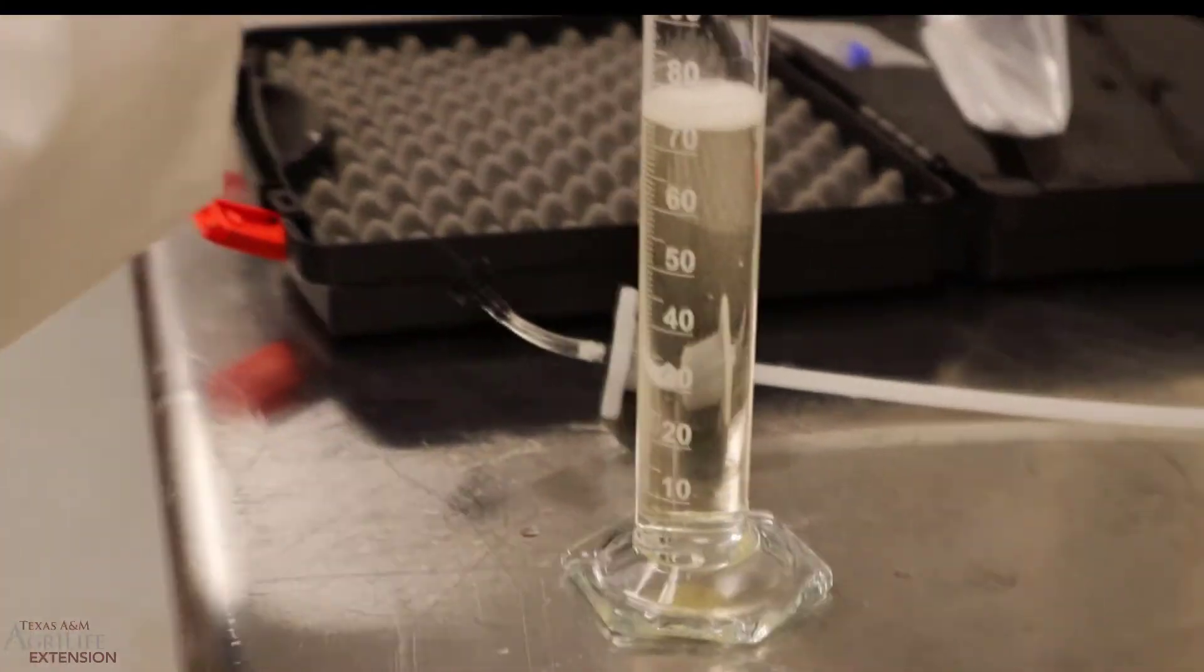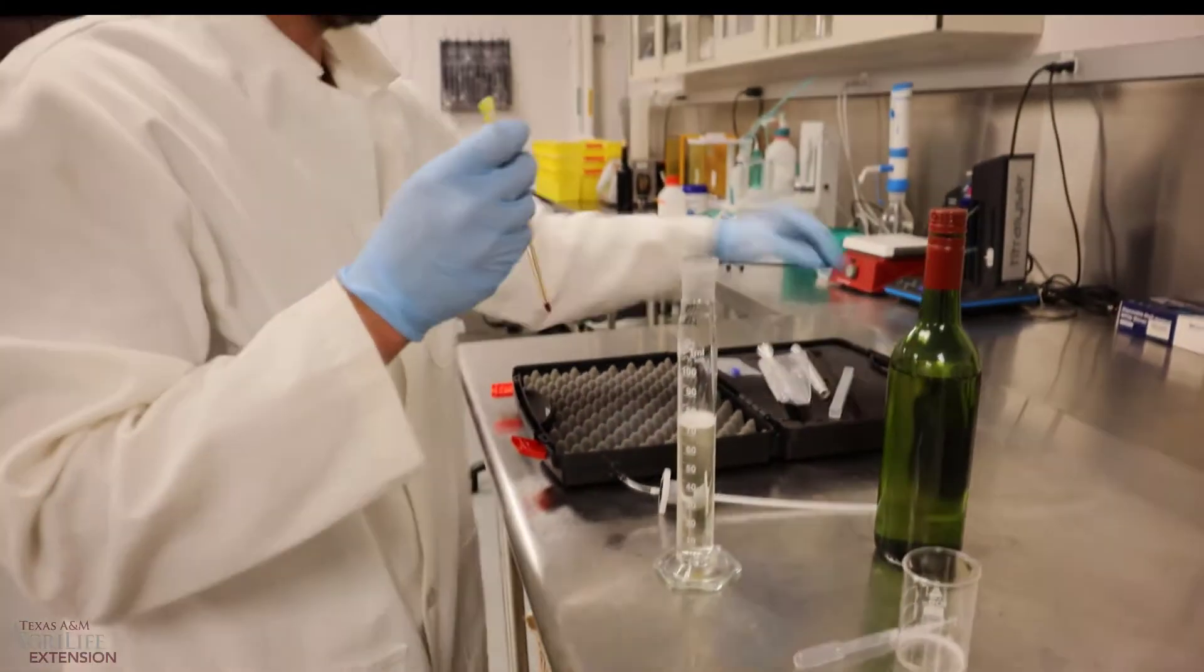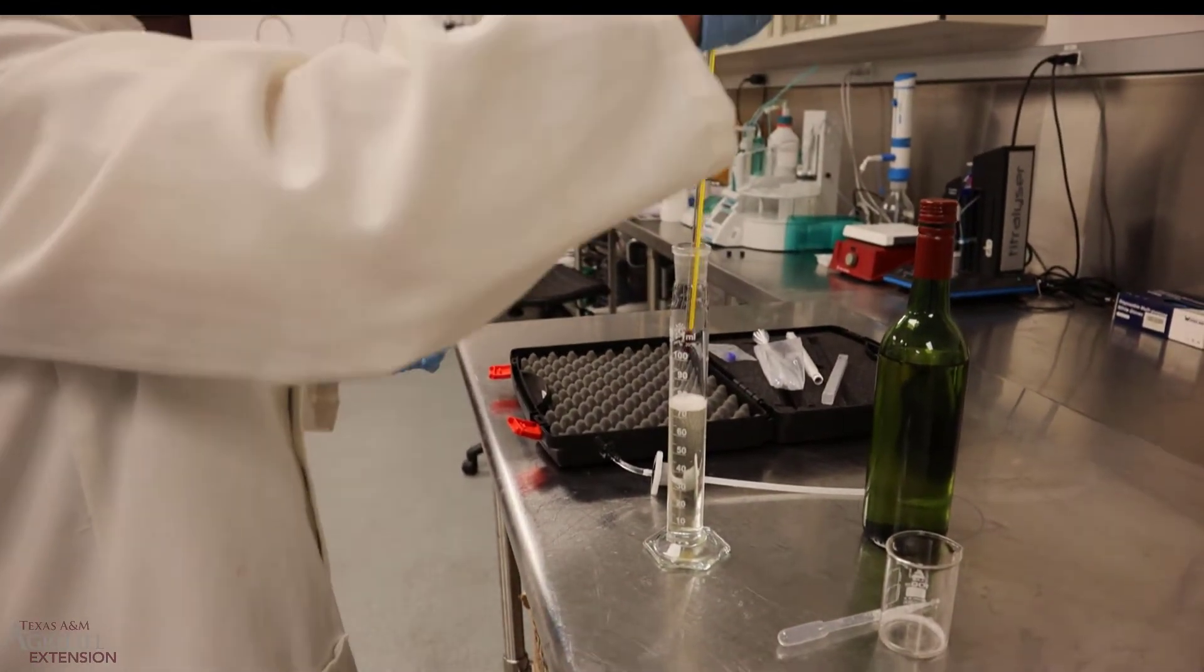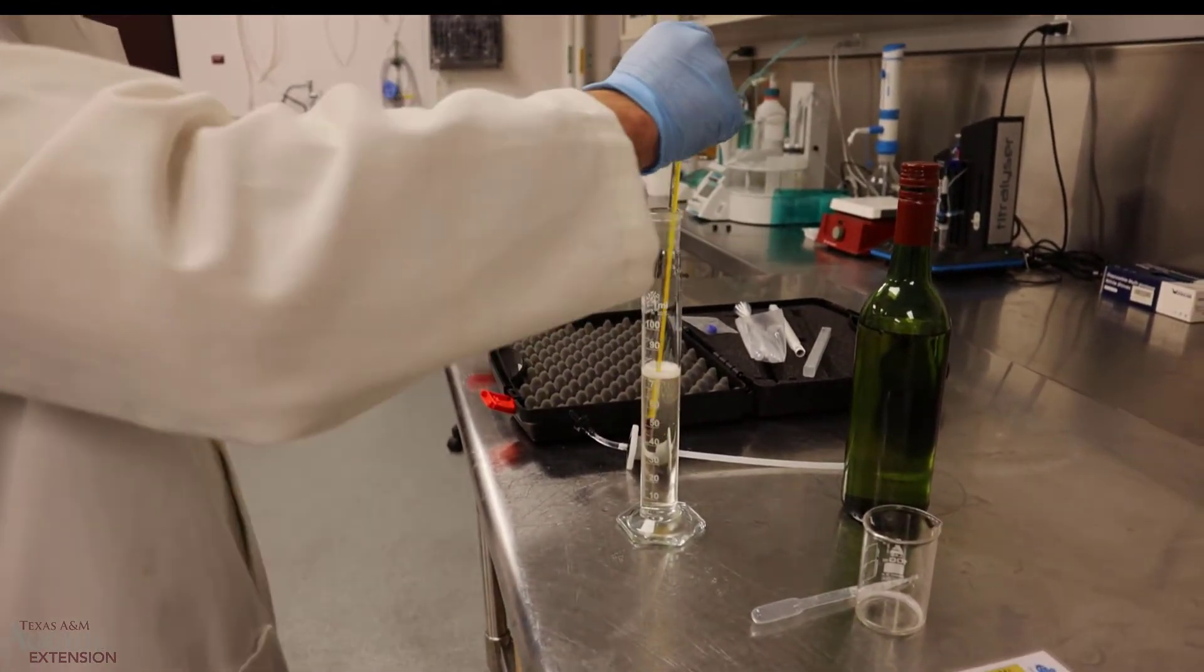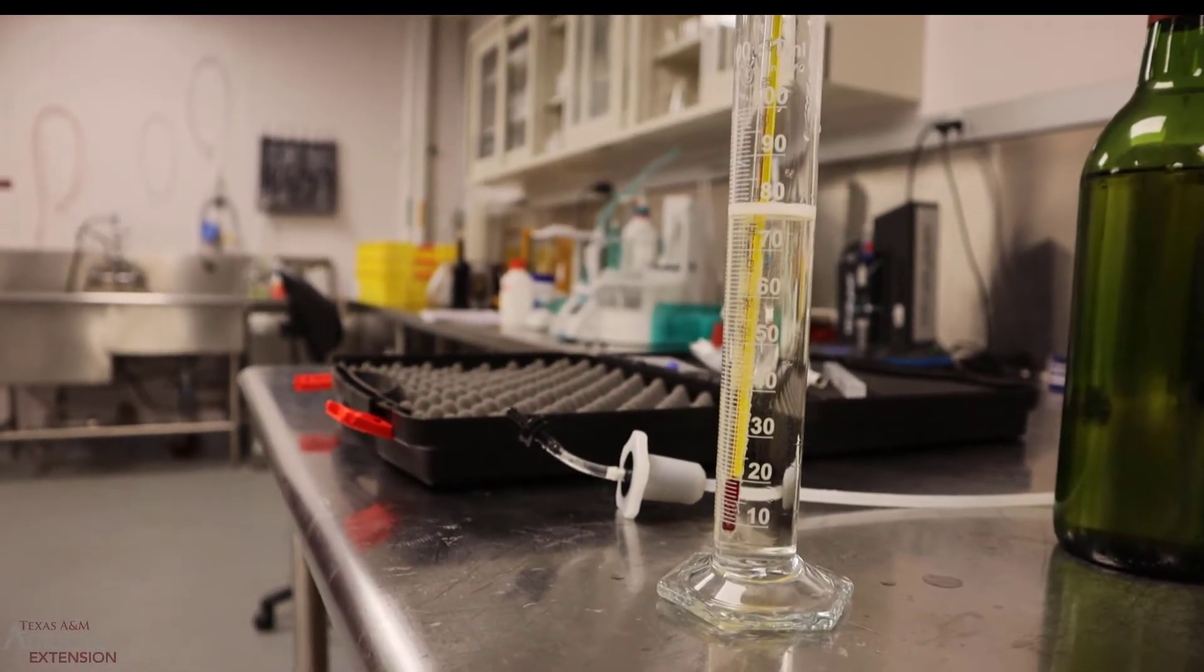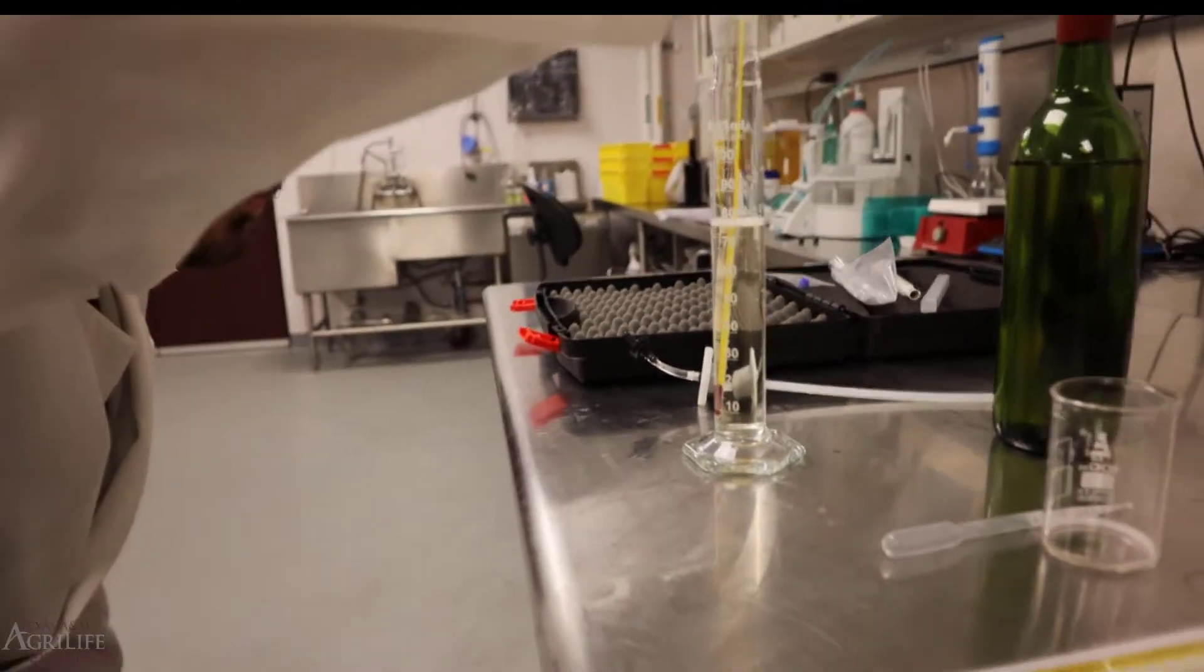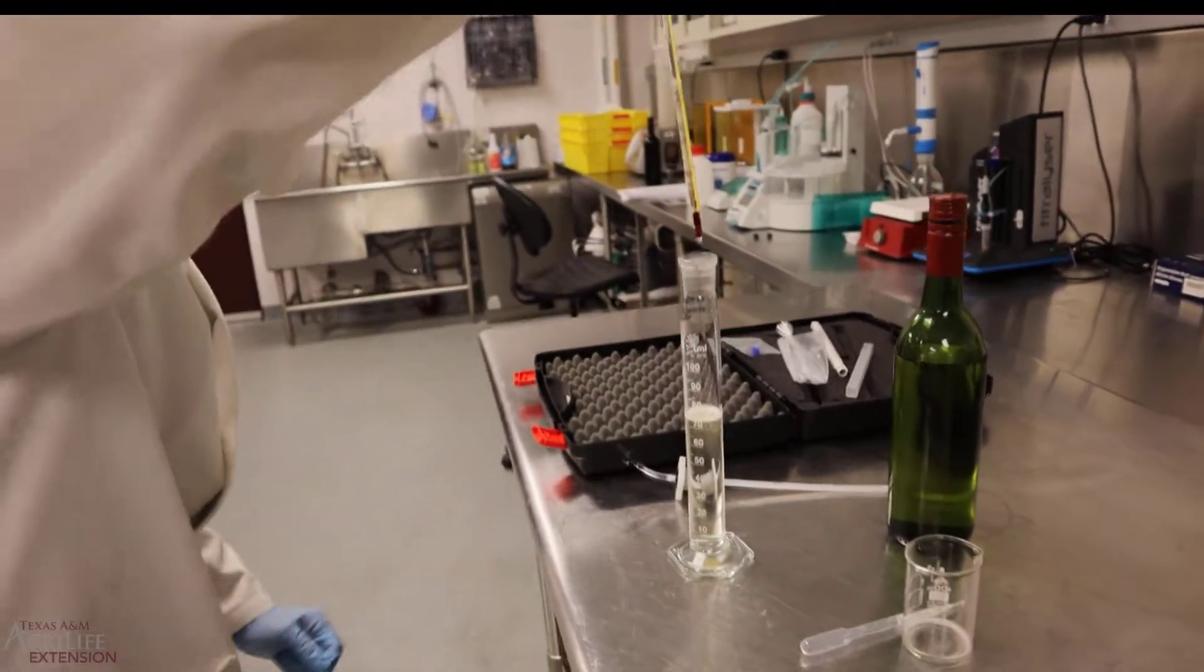While we're waiting for the foam to calm down, we'll go ahead and take our temperature of the wine and we will look at the volume after we take our temperature. Looks like we're at about 23 degrees Celsius for our temperature.